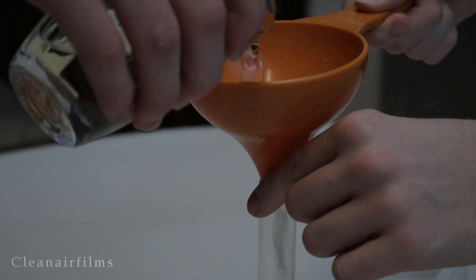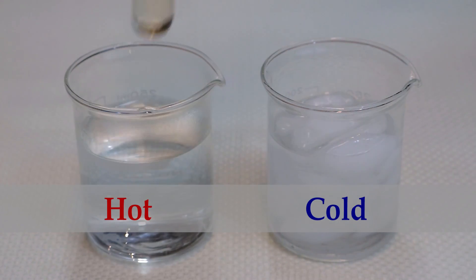Now pour our carbonated drink into a test tube. Place the test tube in the hot water.